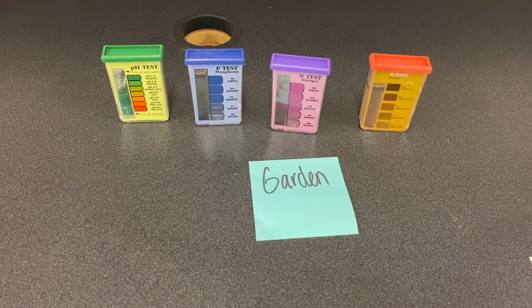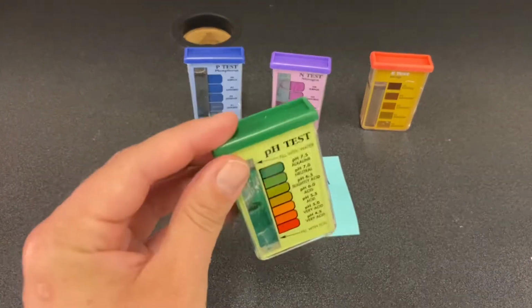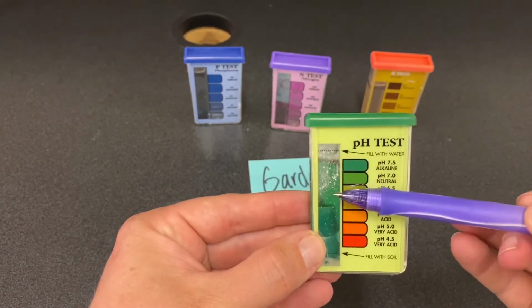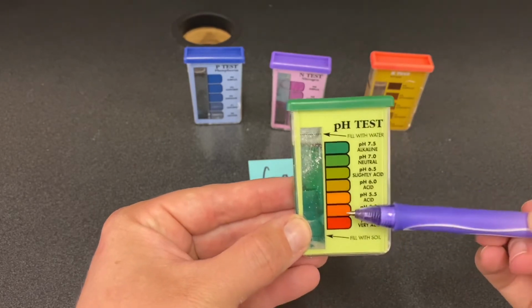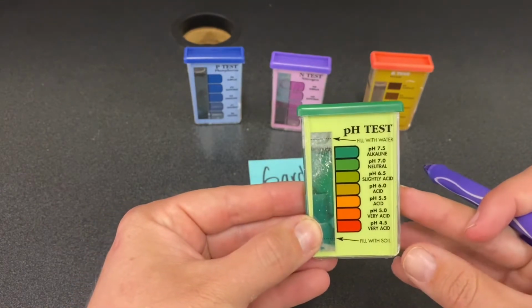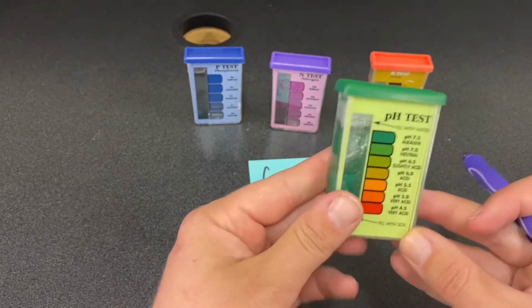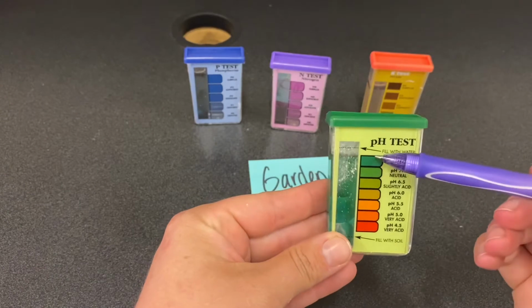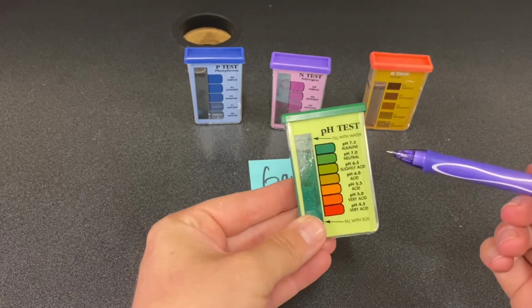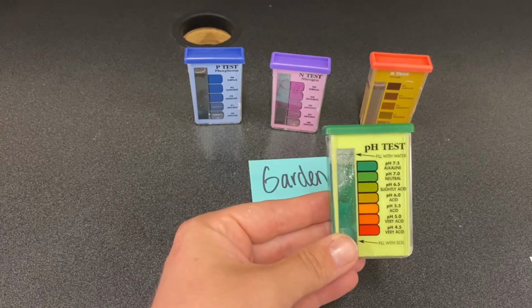So we're gonna start with our soil pH, which is our green test. And I'm looking at the garden soil first. So we're looking for the color reaction as to what does this match on this test so that we can write down the actual result. So it's definitely in the green category. Sometimes it's also helpful to look at just the back. And I'm gonna say that that's actually probably closest to the top reading. That's a very dark green pigment. So that means garden pH is going to be 7.5, which is telling us it is alkaline.